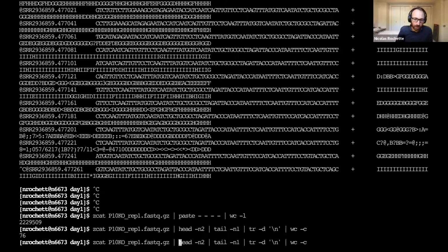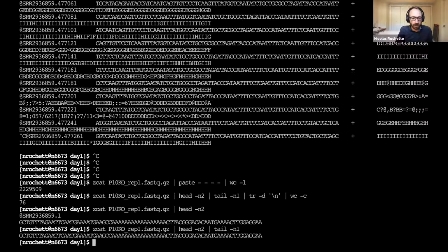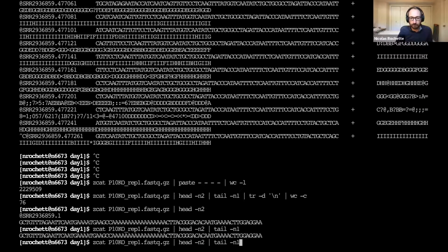Essentially you can break down the first steps. I'm not going to show just this zcat command because it's just going to show the entire FASTQ file again on the screen. But we can start with this head -n 2 command. It extracts the first two lines, and then we can add the next piece of the command, which, out of those two lines, extracts the last line. So that's the second line. And now we're left with just the sequence line.